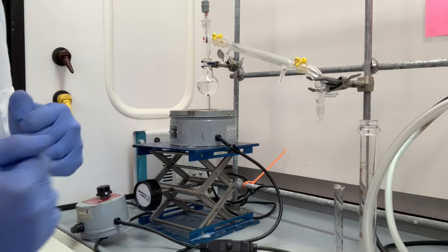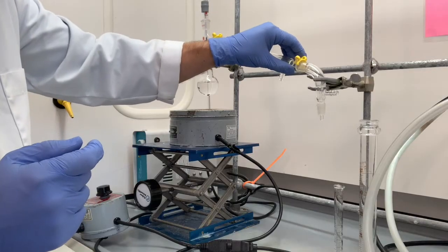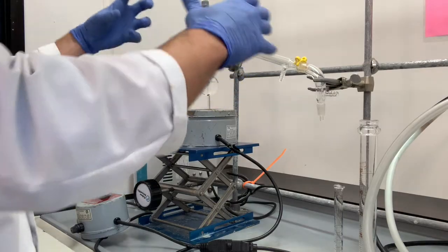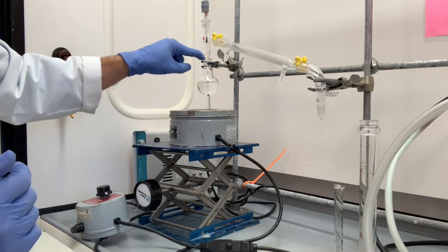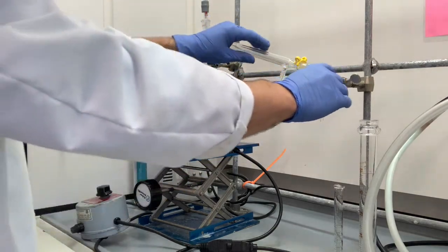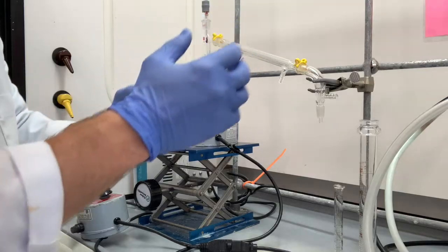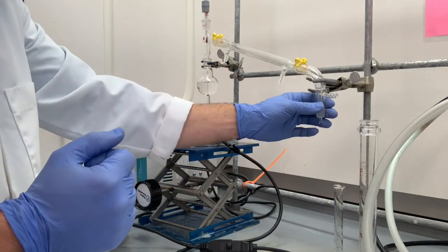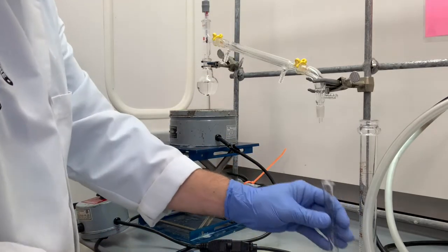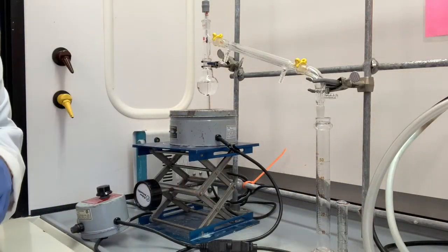So then we're going to use that adapter right here. And now this is where that larger clamp comes in. This larger clamp is just providing some support for this part of the system to prevent any glassware from separating. This junction right here could separate because of the weight of this part of the system pushing down. But if we keep a clamp here that's pretty loosely connected, we don't want to have this really tight, because if it's really tight, it could cause things to separate. Just loosely, just taking care of the gravity, holding things up. You want this whole setup to be high enough that your 50 milliliter graduated cylinder can fit underneath.